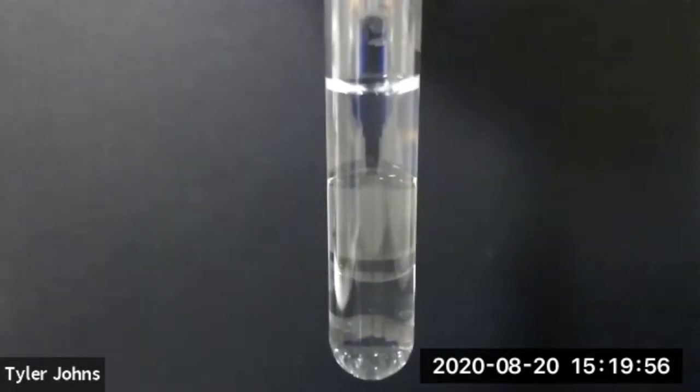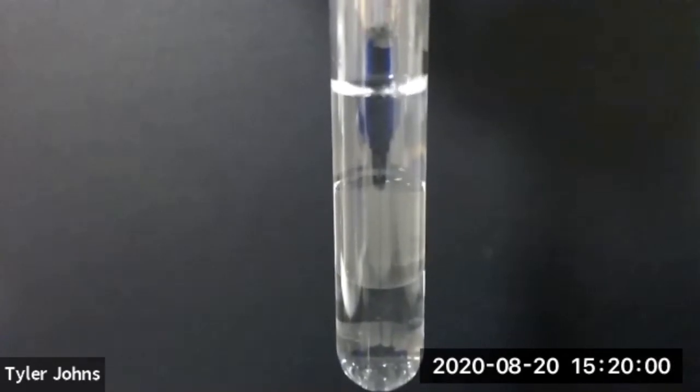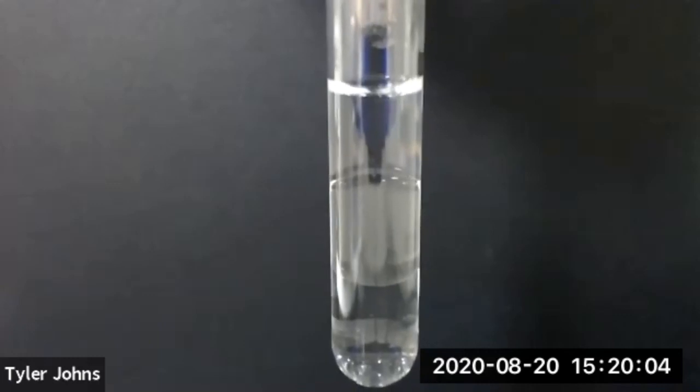You can now determine if the organic layer was the top or bottom layer in each of our three test tubes. This concludes part C of this experiment.